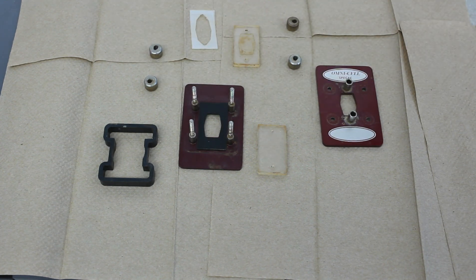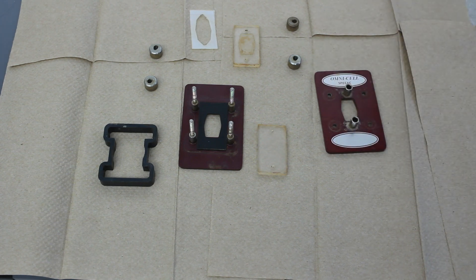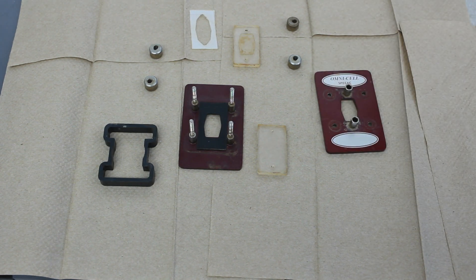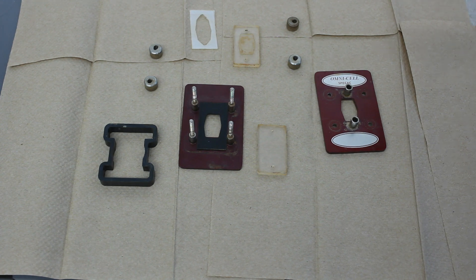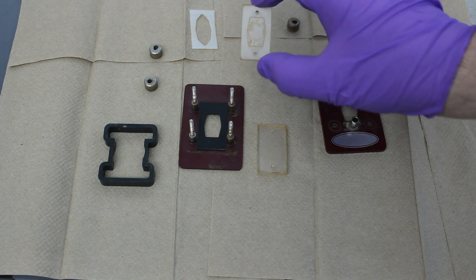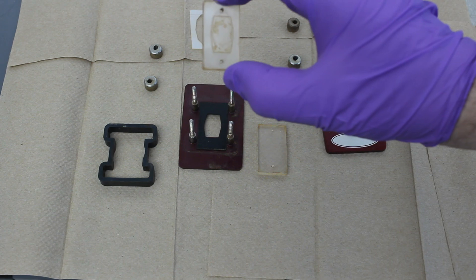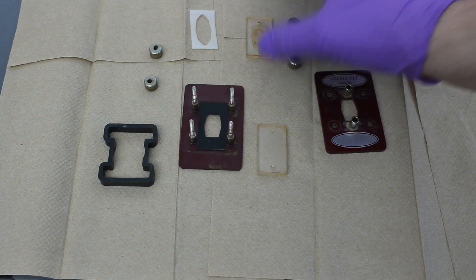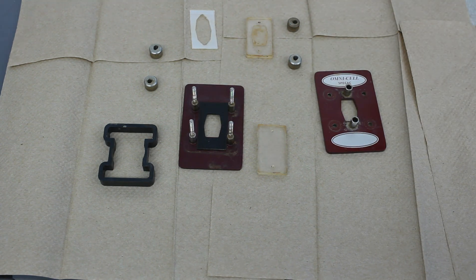This is something that I'm guilty of not doing on a more regular basis. I usually just run the cell until there's an issue. But even though it might be difficult to see through, the infrared beam can still pass through unobstructed.